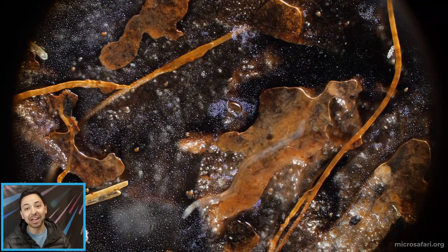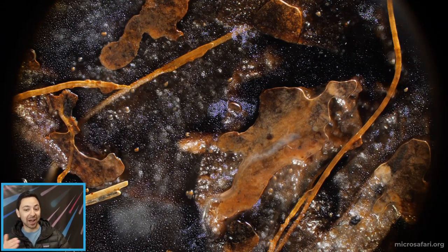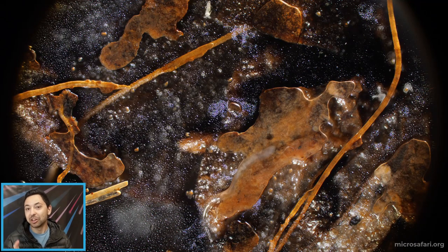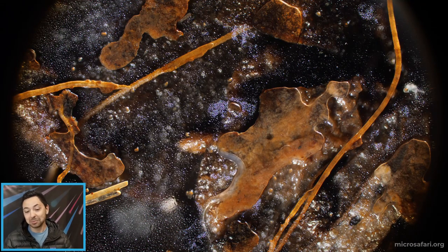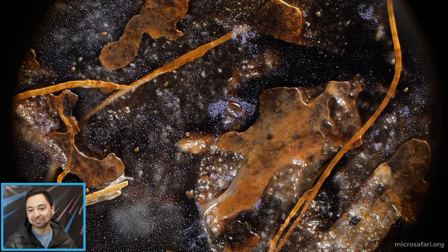Welcome to the Micro Safari. My name is Sarush and I'll be your tour guide on this wacky little alien adventure as we explore through the microscopic landscapes of our soils and just see what kind of little critters we can find.